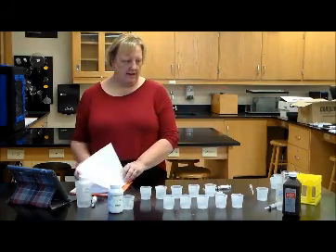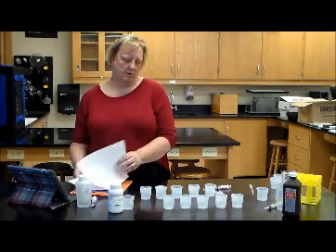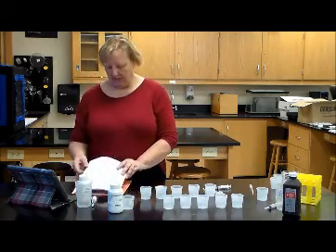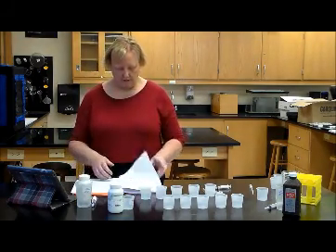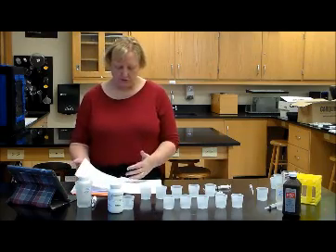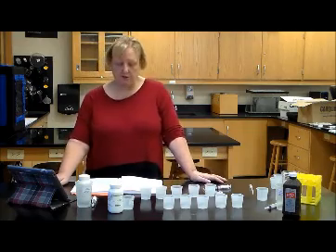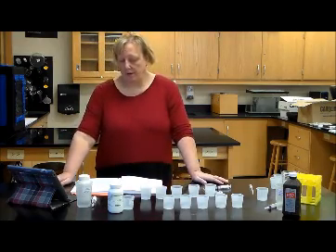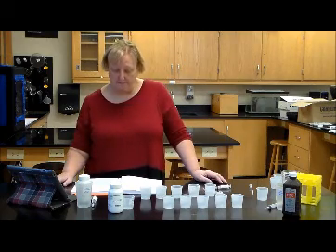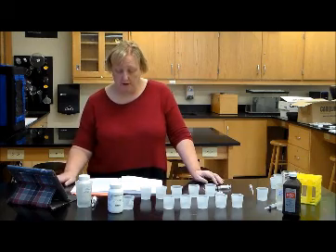Be careful when you're handling the test tube, because if you handle the test tube in the hot water, it will burn you, so be extra careful. If we're looking at your lab papers, page 1 is instructions for activity 1. Then you have some procedures on page 2. Page 2 is kind of confusing about where those components go in your lab write-up. So let me just go through each one of them and tell you where they go.